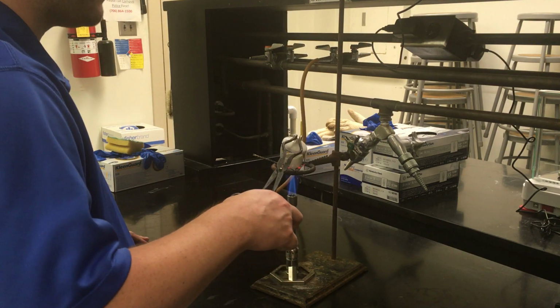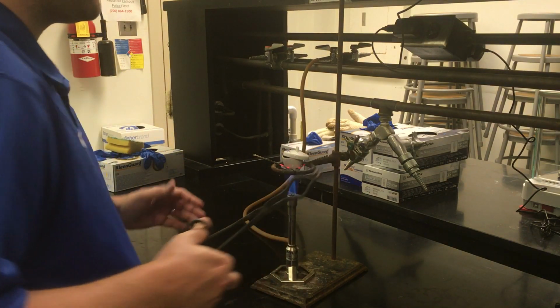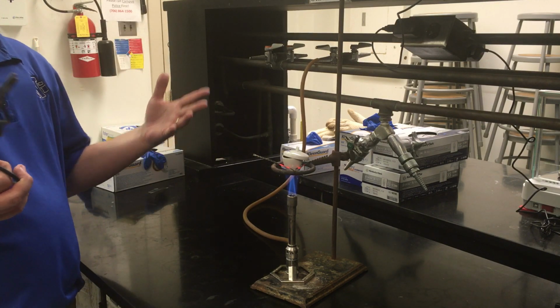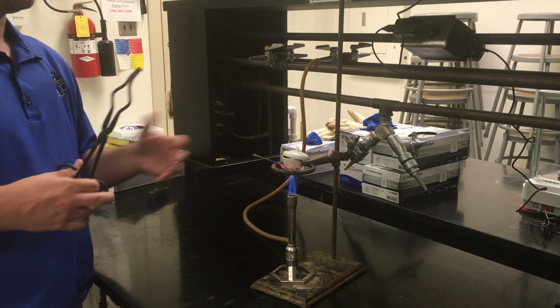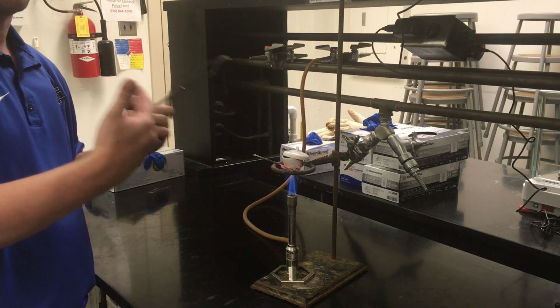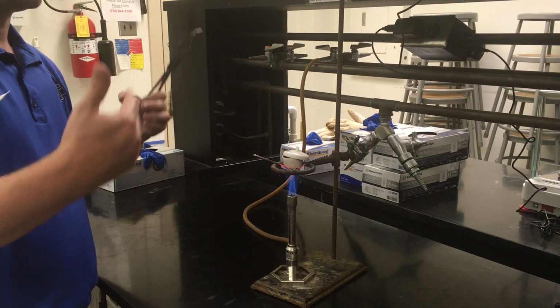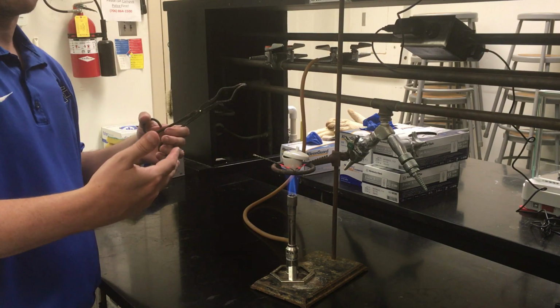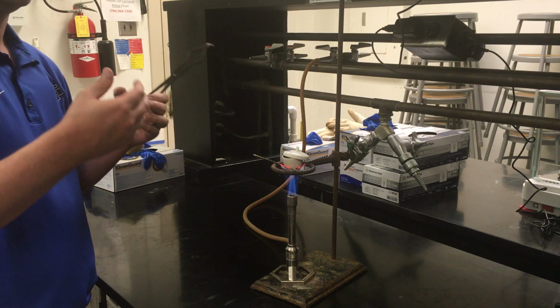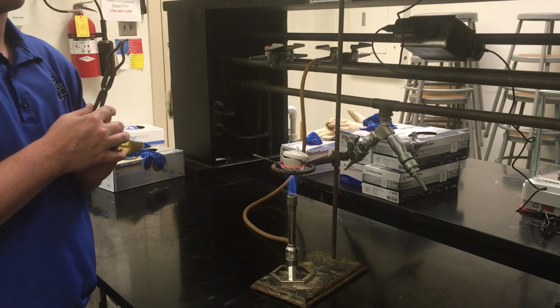For setting up your lid, keep in mind that in order for your magnesium to burn, you need some of your crucible open, but you don't want it full bore open like what I had when I started to set it up. If it's fully closed, there's no oxygen getting in to cause the reaction to happen. But if it's full bore open, there's too much oxygen getting in, and as a result you're going to see it burn too fast. You're going to see a really bright white light and probably some white smoke being given off as well.